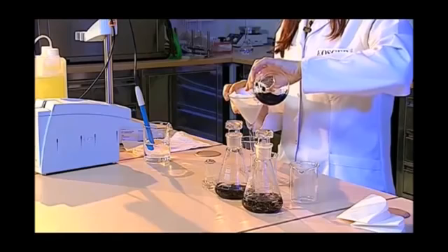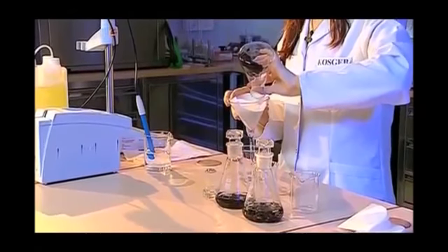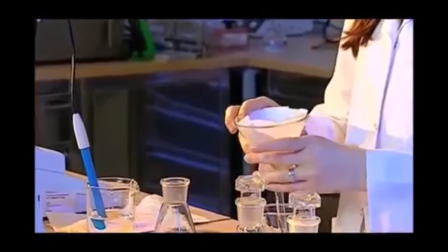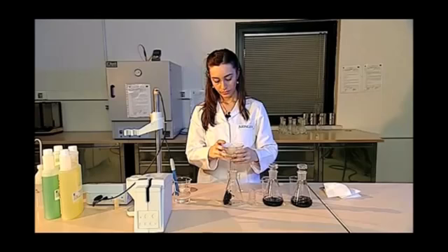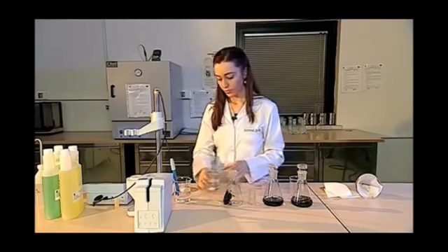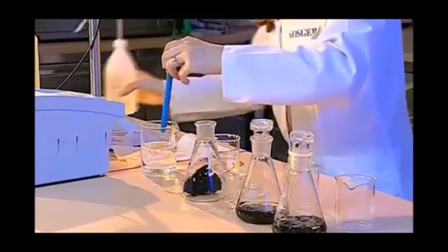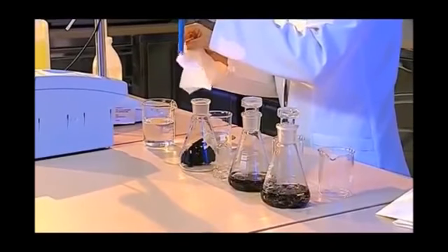In this process, it is very important not to touch the solution with our hands because it may affect the pH value. We wore gloves in the process of the sample preparation, but we don't have to wear gloves here because we do not touch the solution with our hands. After filtering the sample properly, I immediately wash the tip of the electrode with pure water. I dry it sensitively so that there is no wetness anywhere and dip it into the solution.